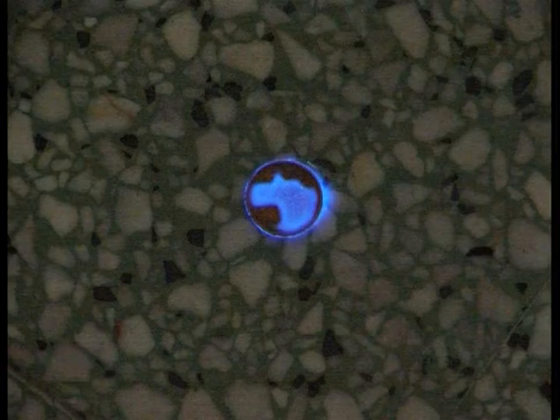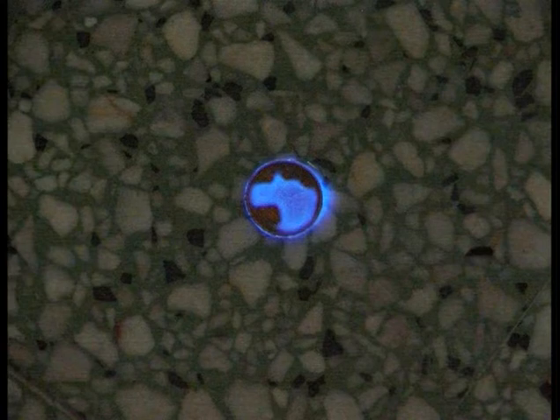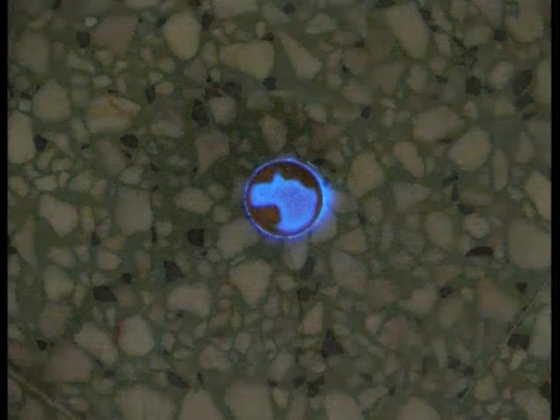Take the example of a simple copper coin that anyone can have at the bottom of his pocket. You should be aware that copper entering the composition of this coin will produce a reaction that is weak, but lasts a long time, so everyone can experience a false positive on copper with a coin.